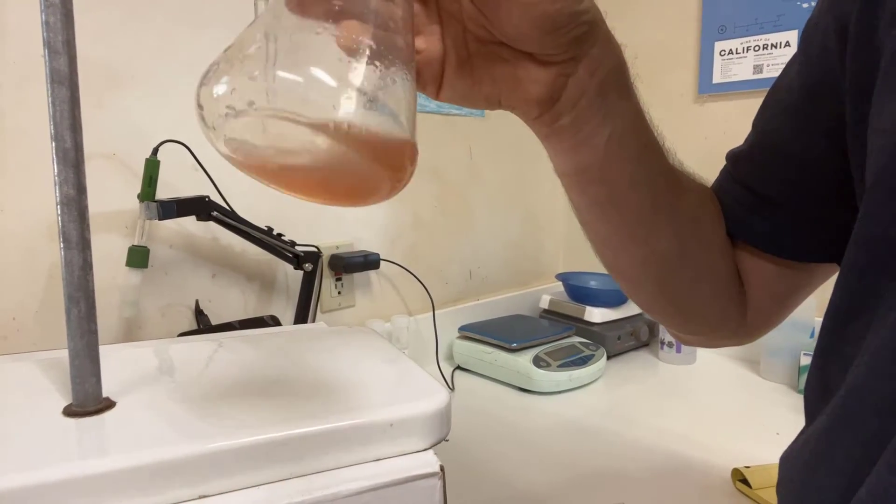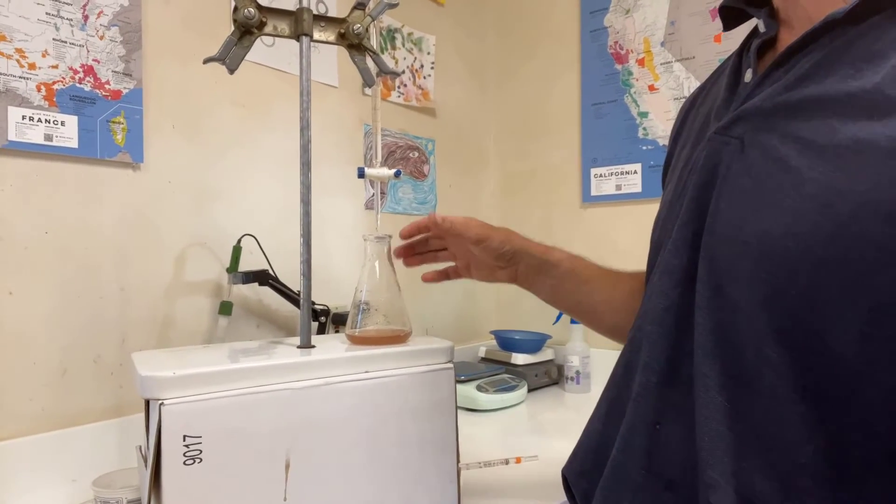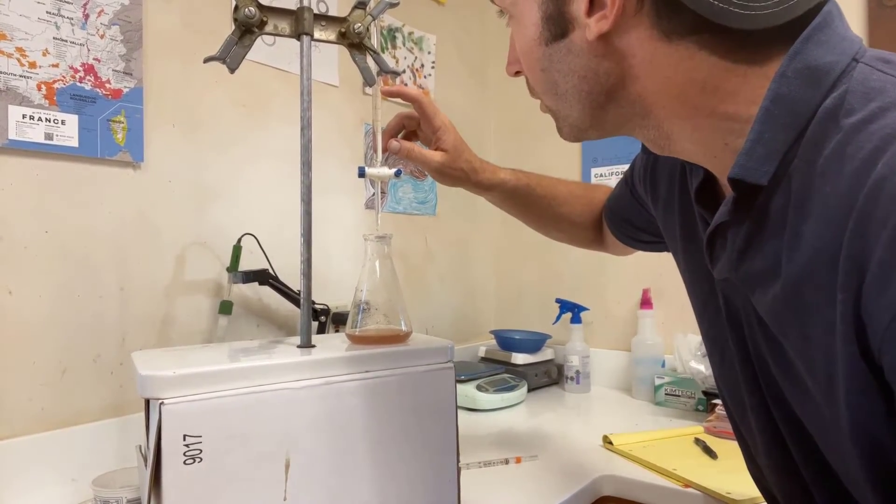Okay. Pink color's persisting. So we're done. Now we come back to the burette to measure how much sodium hydroxide was delivered. The final reading is 21.2.